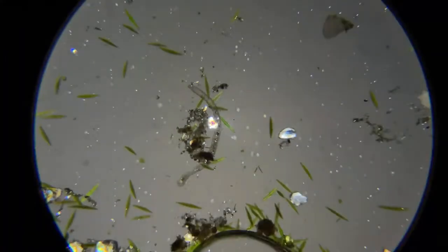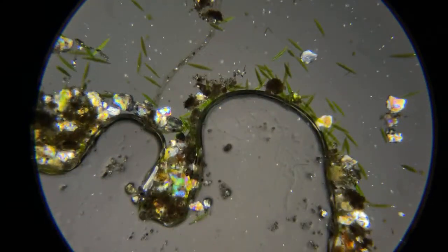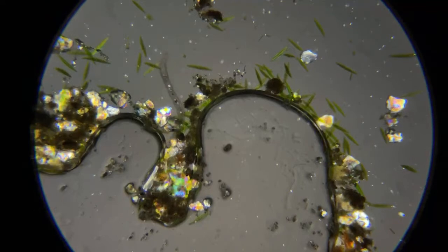I'm gonna zoom out on him. Oh, it looks like he's in outer space. I'm gonna try to share my screen over to Reddit. Hey, he's living dangerous. He's going to the edge of the world.